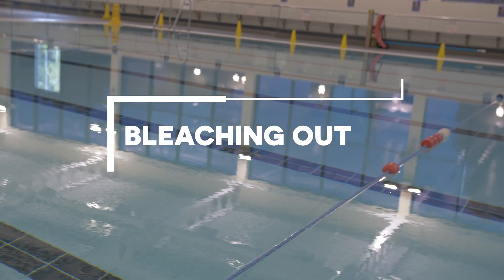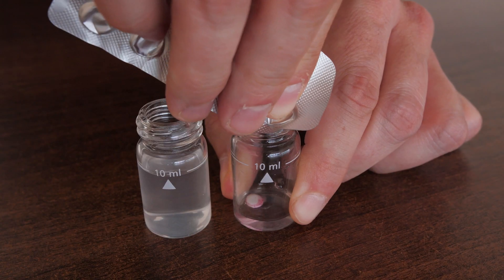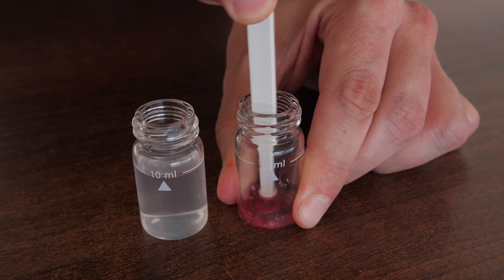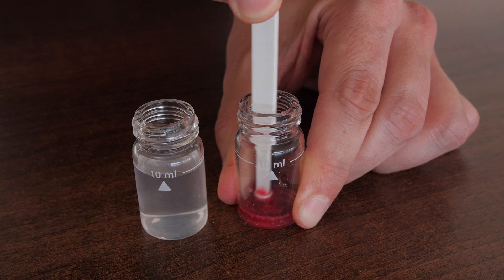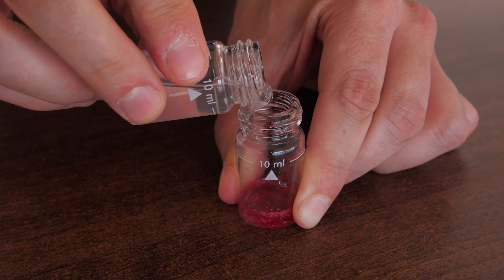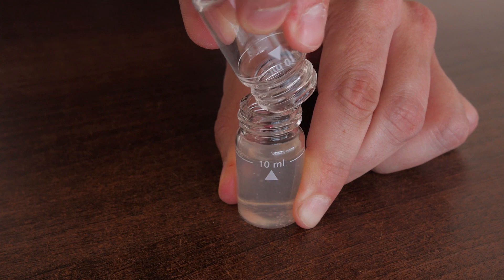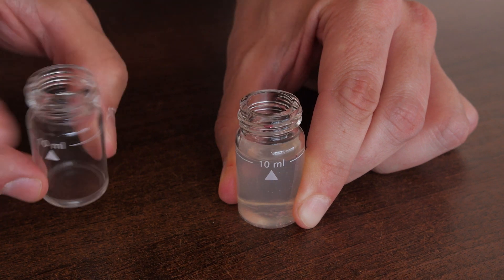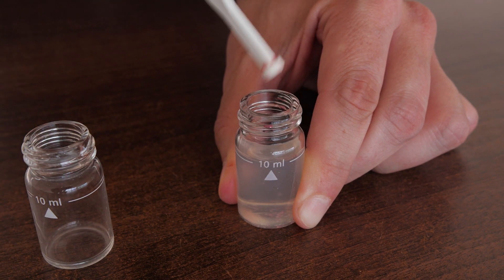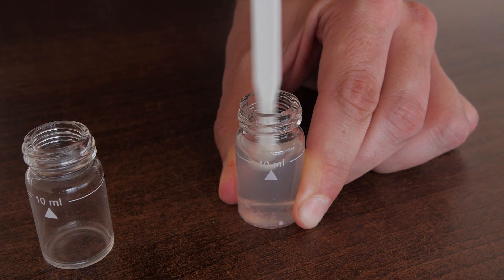Should the sample bleach out during the free chlorine test — for example, a flash of pink then clear again — this indicates high free chlorine and the dilution method for water that is over-chlorinated should be followed.